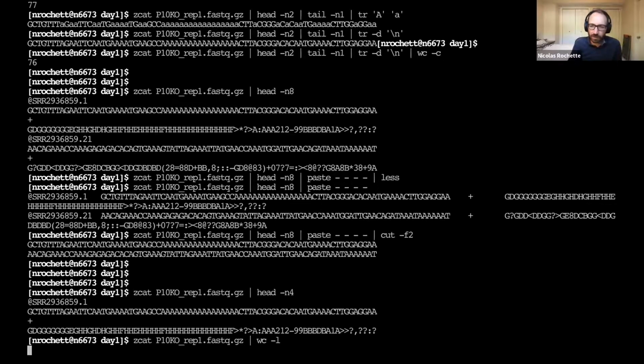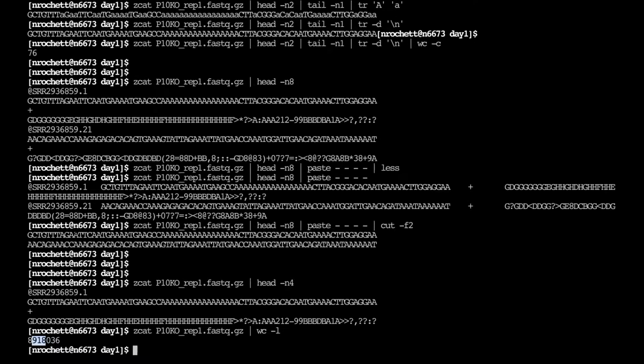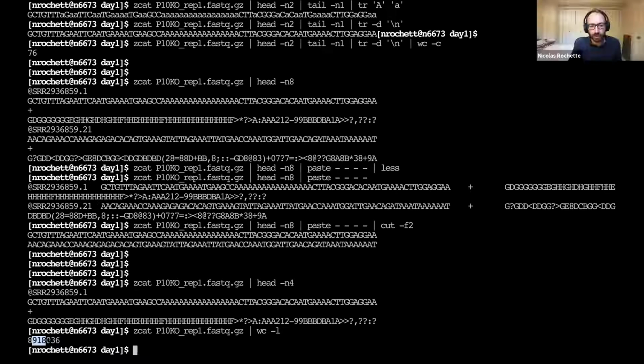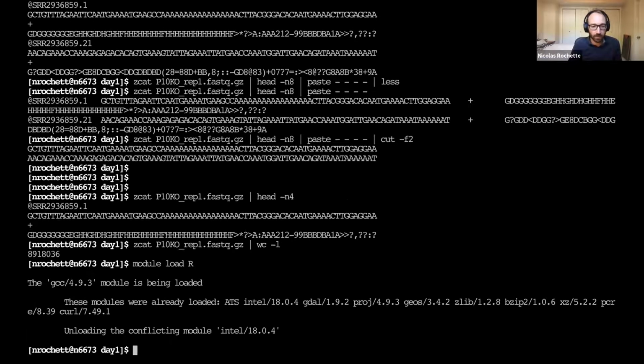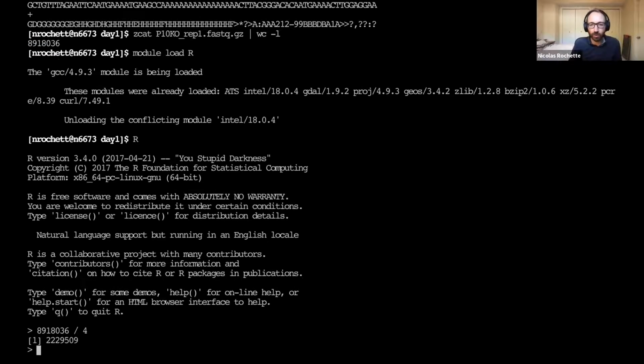So we can do it like this. I think it takes a few seconds. Yeah. And so here we have this many lines. How many reads does this correspond to? So like a fourth of that? Yeah, so we take this number divided by 4. There are many ways to do this. One way is with R. I just open R, copy paste this number divided by 4. And that gives us 2.2 million reads.